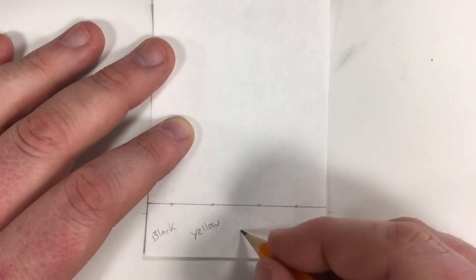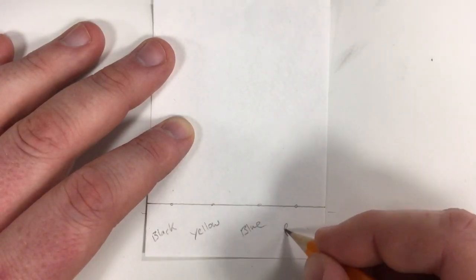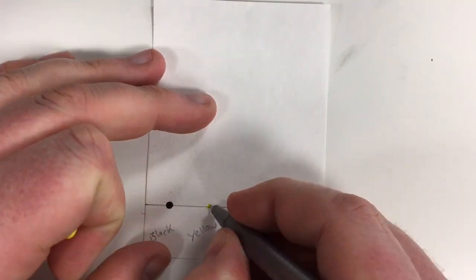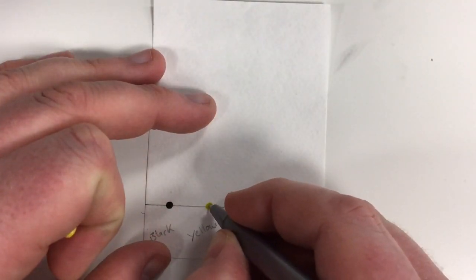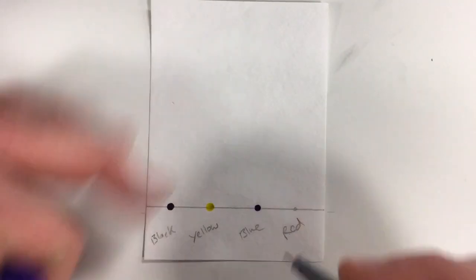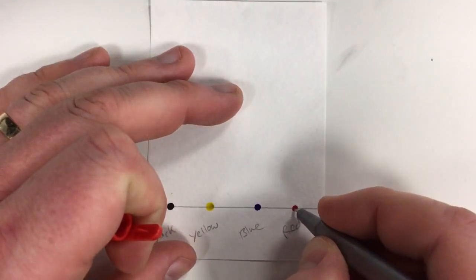We will then define the area in which we will place our inks and label their respective colours. Following this we will place a concentrated spot of our soluble inks at each of the defined areas. The spots should be placed a reasonable distance apart as during the experiment the colours can tend to run and this will prevent inaccuracies during the results analysis.